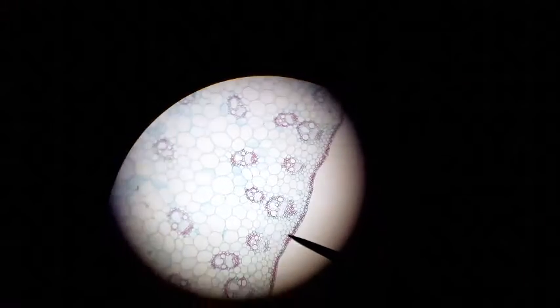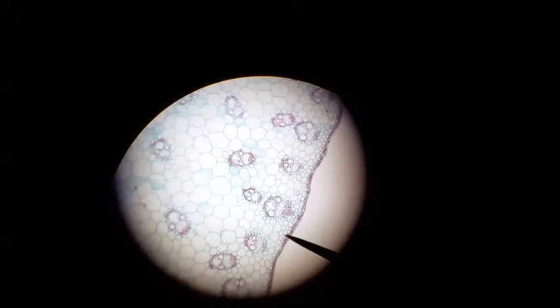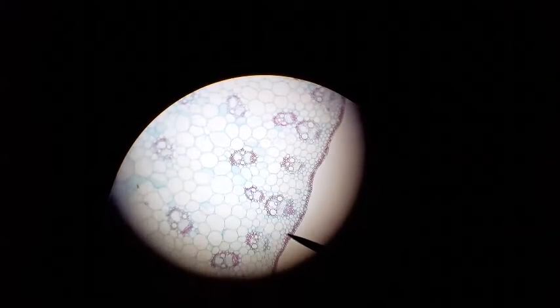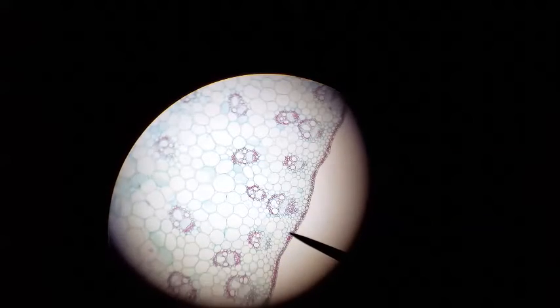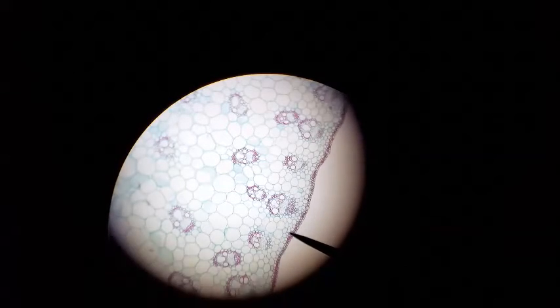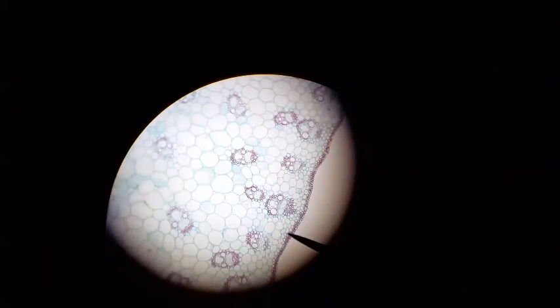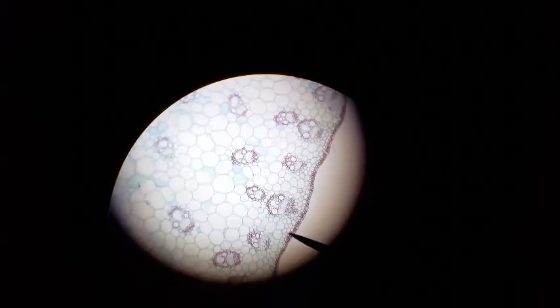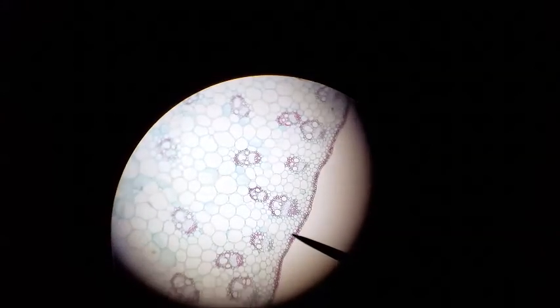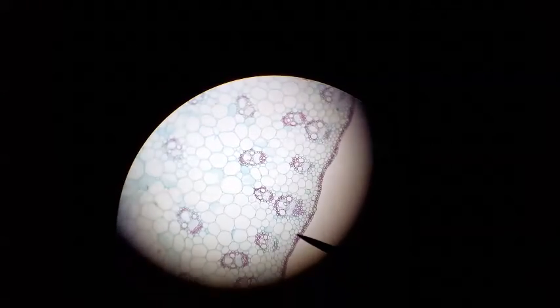There is a fibrous sheath around these little islands called sclerenchyma, and inside the little islands there are openings that are the xylem, and then the other portion is the phloem. We'll get to that in another slide.